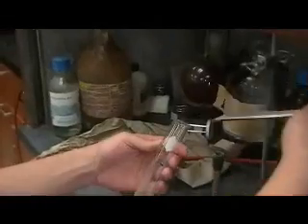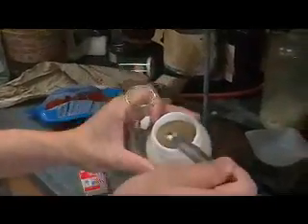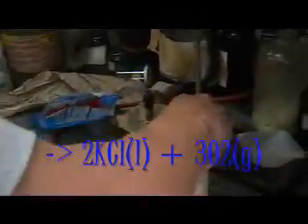By heating the potassium chlorate over a Bunsen burner, you will be able to decompose the solid to form potassium chloride, KCl, and O2 gas.